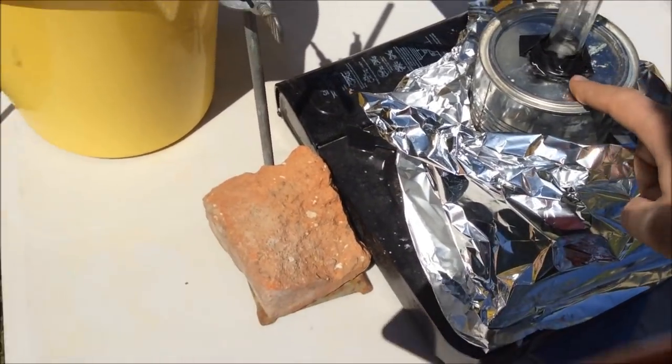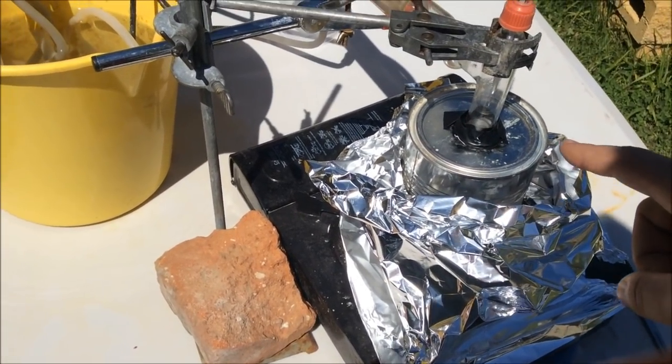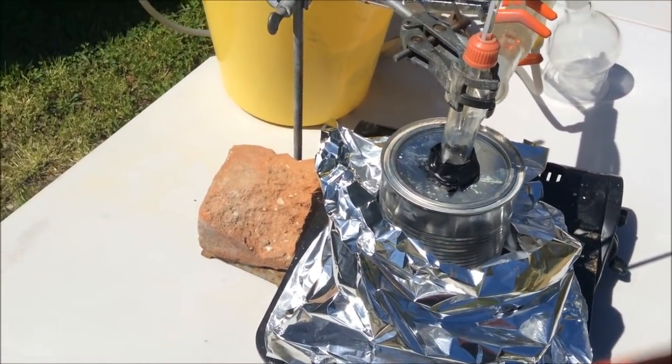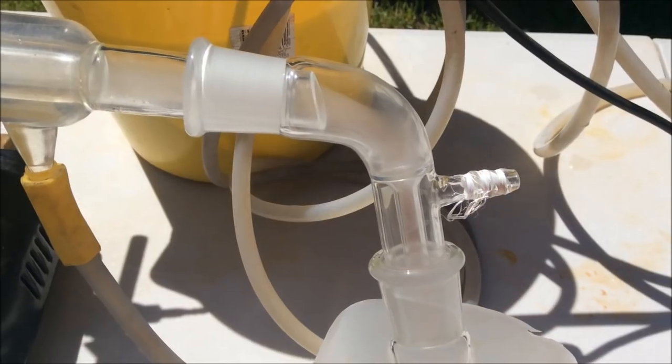Maybe. And this shouldn't get too hot anyway, because this is coming over at 80 degrees, right? Maybe, sort of. Probably not. But, you know, we'll try it. Nothing that bad can happen, right? Sure? Maybe?